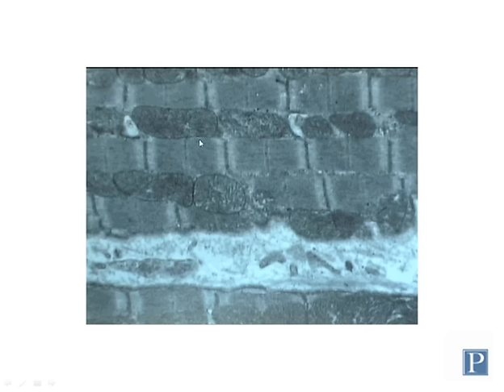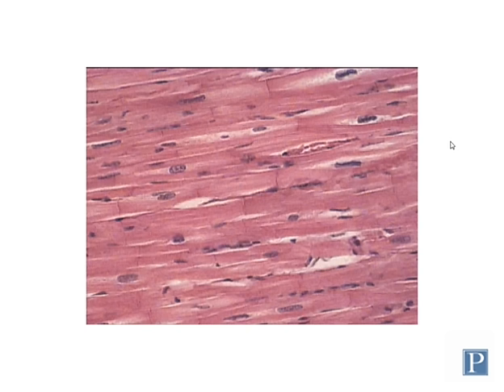skeletal muscle cells, and you can see mitochondria and some other organellar structures between these myofilaments. In cardiac muscle tissue, the arrangement is very similar, and we actually do have some electron micrographs of these for cardiomyocytes, so take a look at those when you're in lab. This is a light microscopy section of cardiac muscle that's been stained with H&E.